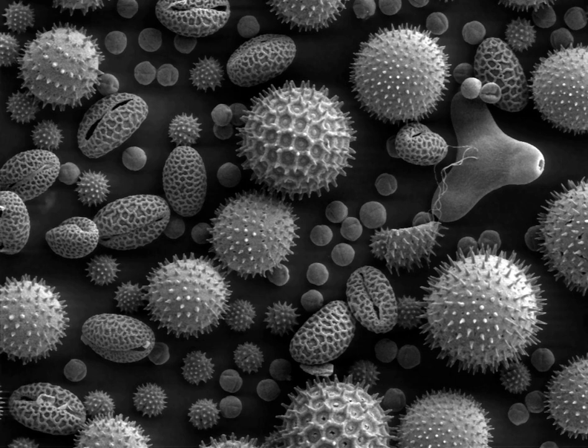Very often, published SEM images are artificially colored. This may be done for aesthetic effect, to clarify structure or to add a realistic appearance to the sample, and generally does not add information about the specimen. Coloring may be performed manually with photo editing software, or semi-automatically with dedicated software using feature detection or object-oriented segmentation.